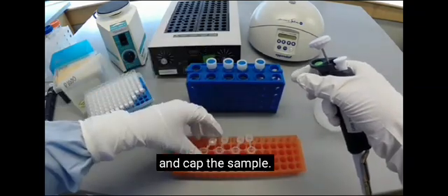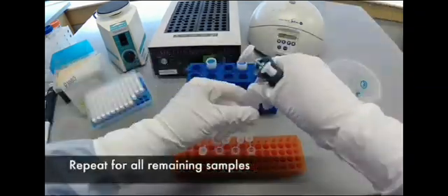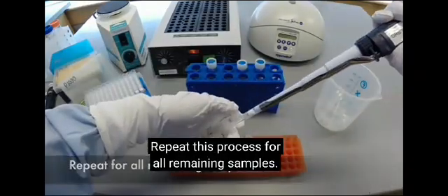Once transferred, close the spit tube lid and cap the sample. Repeat this process for all remaining samples.